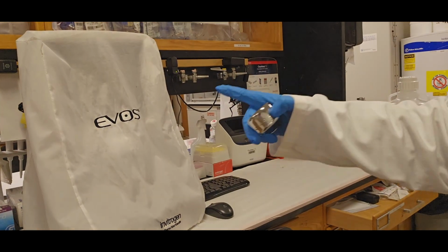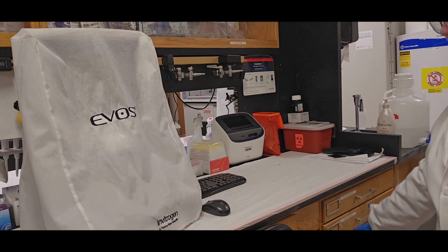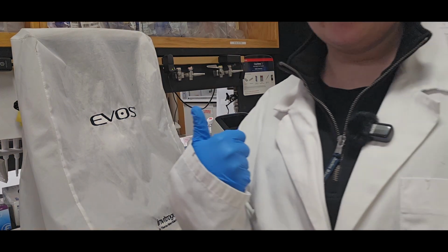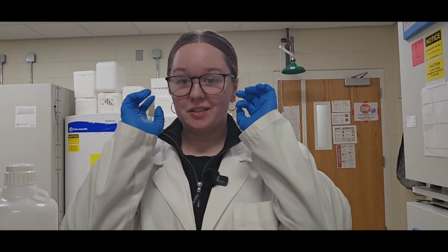I recovered the EVOS. I'm going to put the cell counter back in the drawer. And that's good for cleaning up the cell counting station. If you get really good at that, you should be done right as your cells are done spinning down. And then at that point, you have a cell count, you know what you want to do next, hopefully through your Excel sheet, and then you can continue working in the biological safety cabinet.